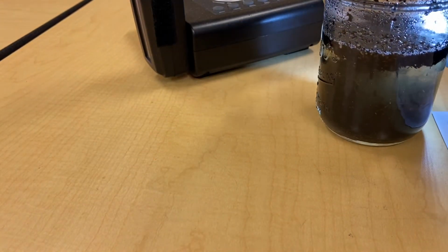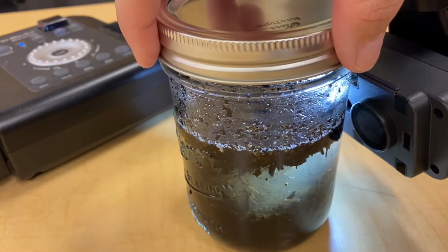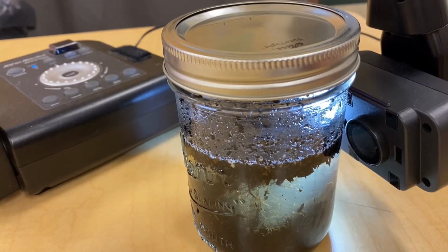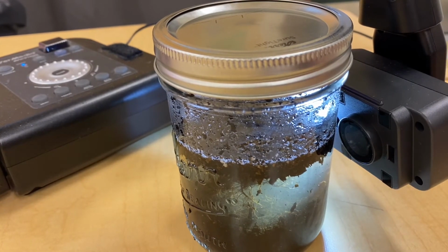We are currently looking at the garden soil sample. So you're starting on page 3 with the student worksheet and the table labeled garden soil sample. I know that this lab would be a lot easier to do in person, and it's going to be hard to see the very small differences between these layers according to the chart. So I understand that.